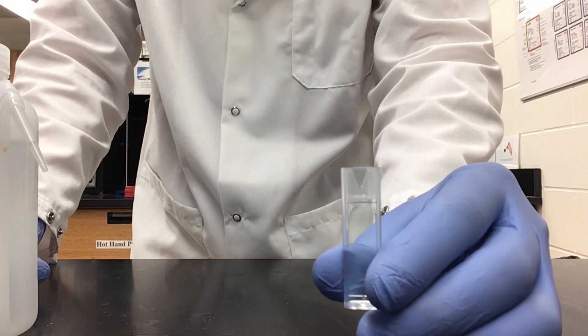As I said, our dilution was an 11-to-1 dilution in the end, because we used 10 parts isopropanol and one part tetrachlorocobalt. Next, we are going to need our hexa-aqua cobalt complex. This one we do not need to dilute, so I simply need to add some to my beaker and then pour into my cuvette.